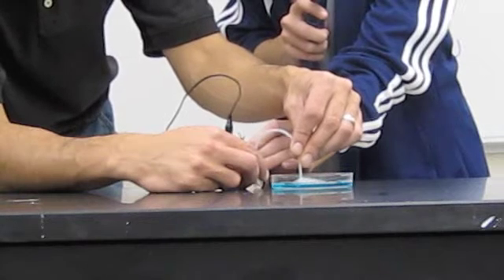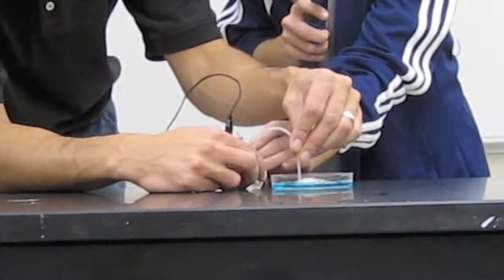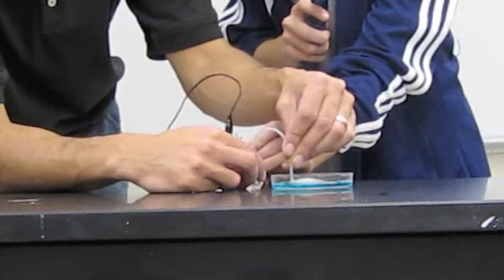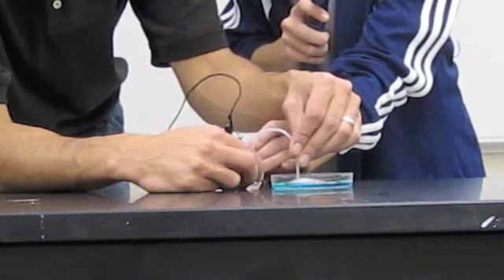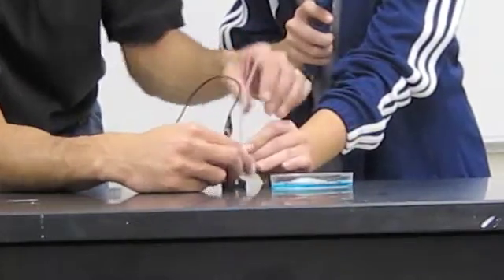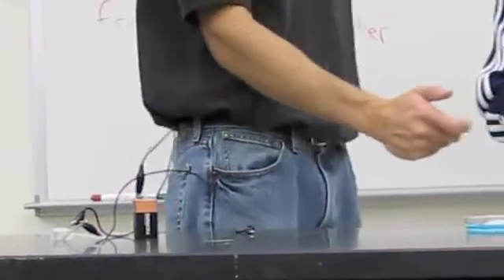Okay, so right now we're just making a whole bunch of hydrogen bubbles. Okay. Now, this is a little petri dish. There's not too many bubbles that can fit in here. Okay. All right, Mullen. Let's see if this works. We might need to. Okay. So I want you to light it first back here. Very good. Now touch it to those bubbles.